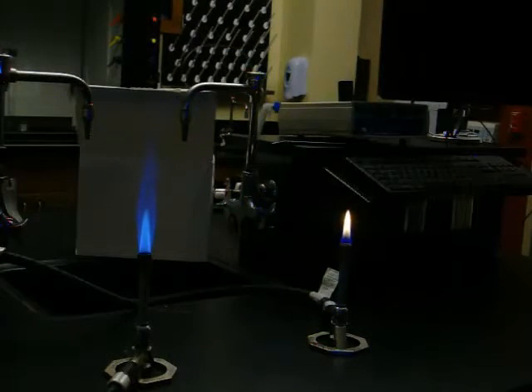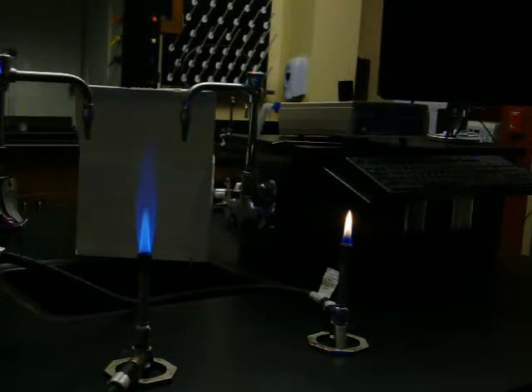These are two identical Bunsen burners. The flames look different because they have been set differently. The bottom valve regulates how much gas is fed into the burner.